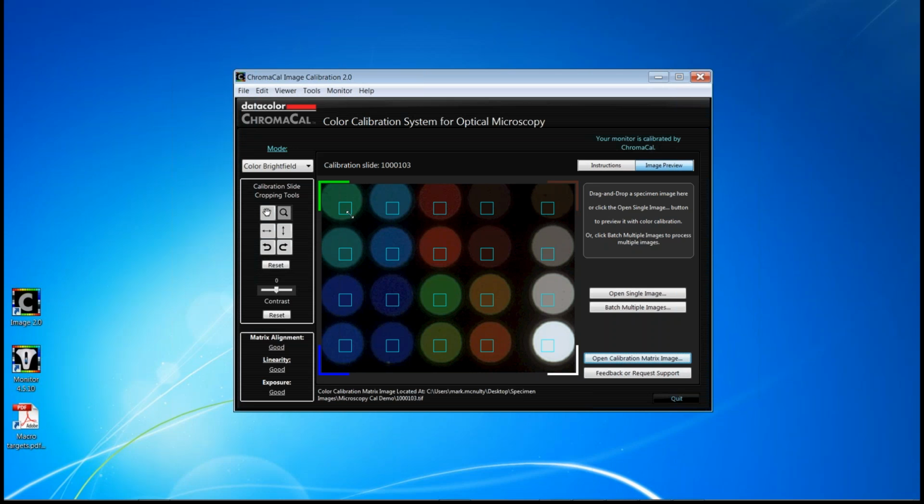You also may have noticed that the orange squares turn to blue. That's an indication that you're aligned. Plus, we offer this diagnostic box in the lower left-hand corner in which we provide not only a text of whether your alignment is correct, but once that is correct, it also provides you diagnostics on linearity as well as exposure. Linearity is extremely important for both qualitative and quantitative evaluation of specimens. It ensures that there's consistency in the underlying data.